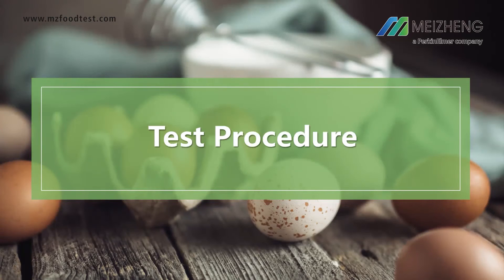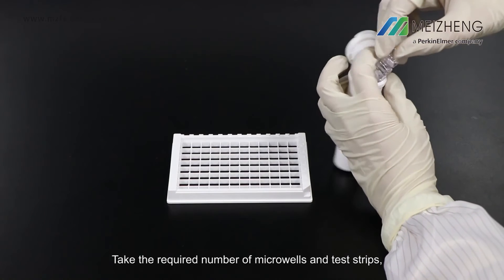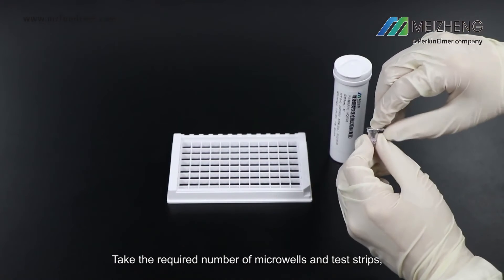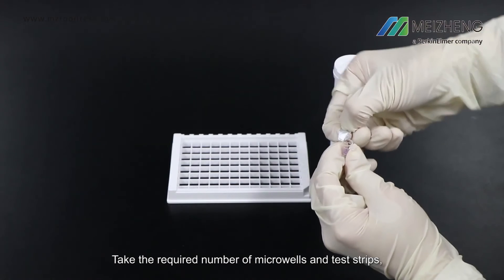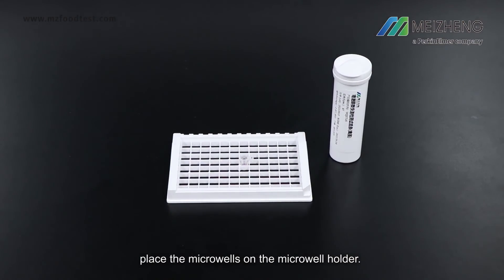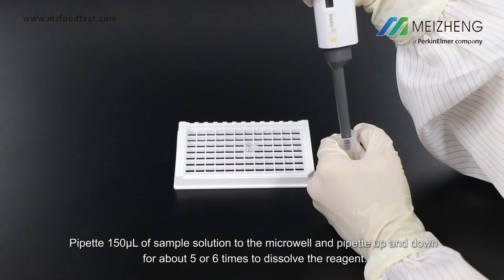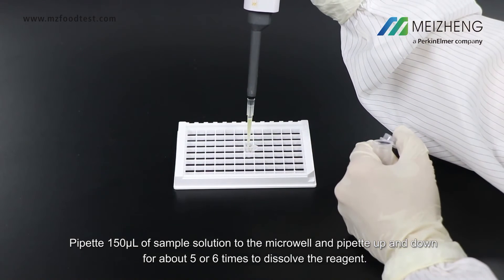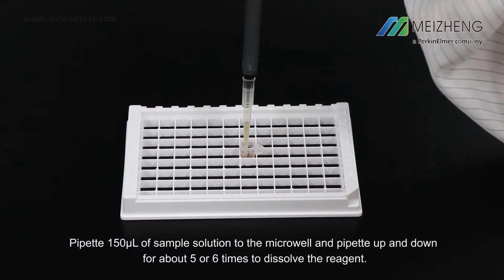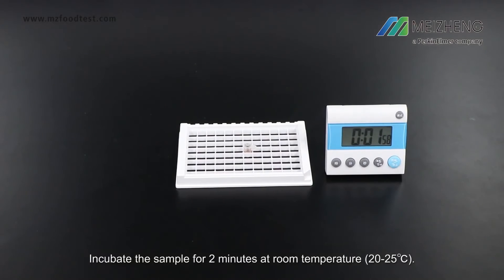Test procedure. Take the required number of microwells and test strips. Place the microwells on the microwell holder. Pipette 150 microliters of sample solution into the microwell and pipette up and down 5 or 6 times to dissolve the reagent. Incubate the sample for 2 minutes at room temperature.